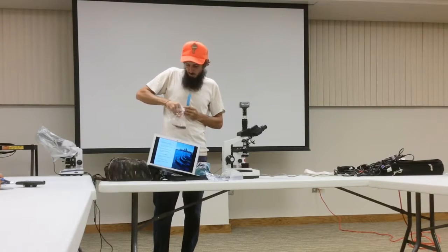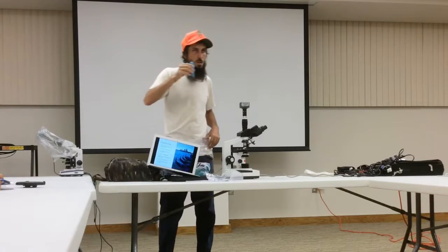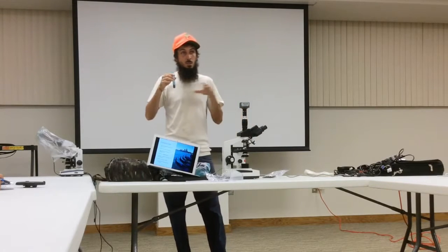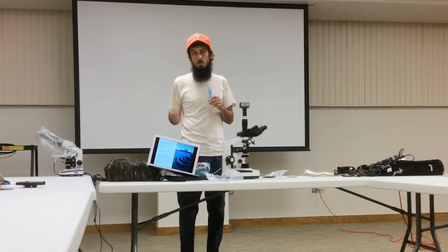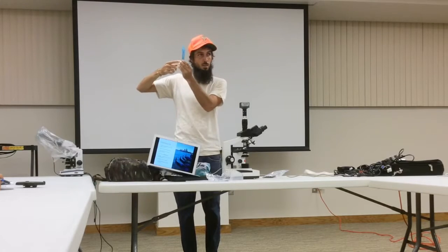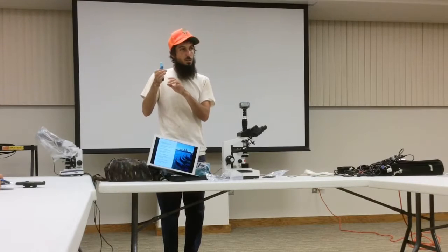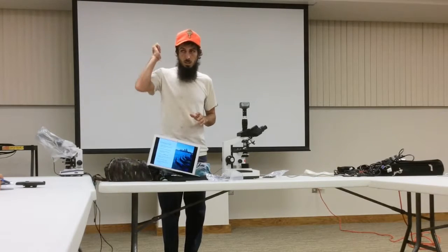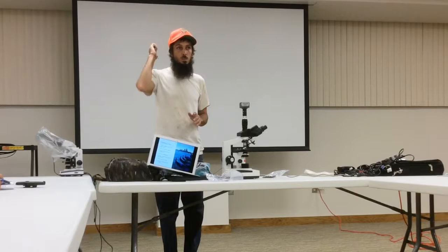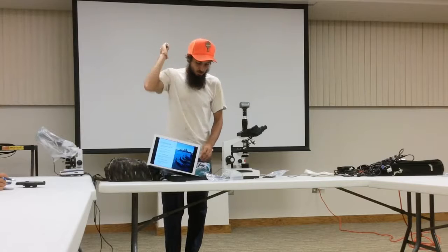You also change your dilution based on how your sample ends up looking. If I'm looking through and I can't see anything, it's too muddy, then I can dilute more. If I'm trying to count certain things, but 1 to 5 I find is good. So you see now it's up to 5. The next part is to shake it, because all the biology is on this stuff. Do it as consistently as possible for about 30 seconds. I'm not trying to super tear it off, I'm just trying to be pretty even with this.